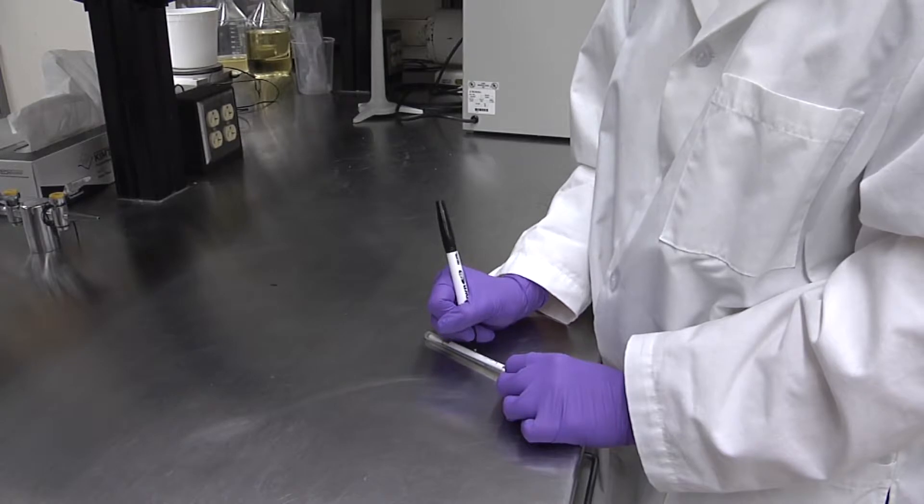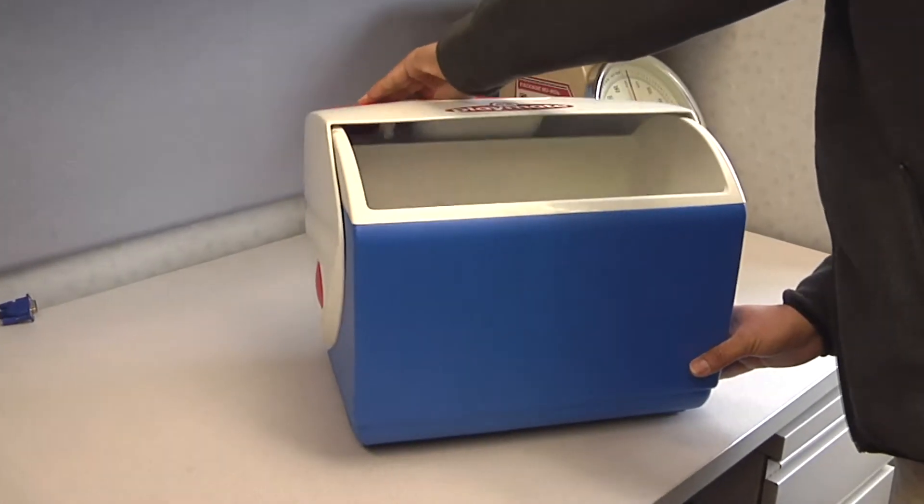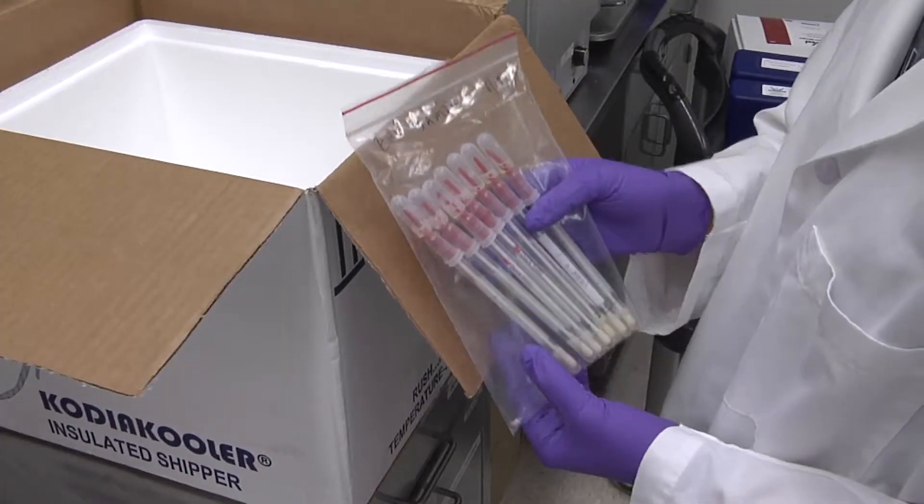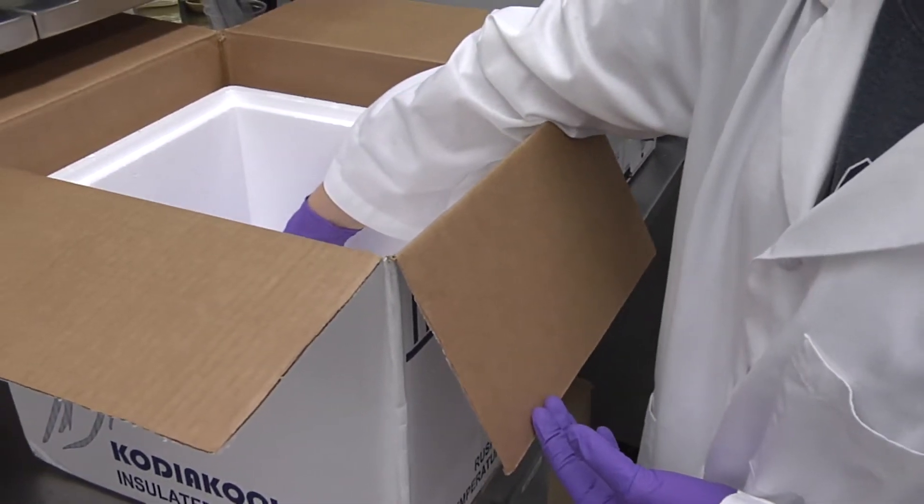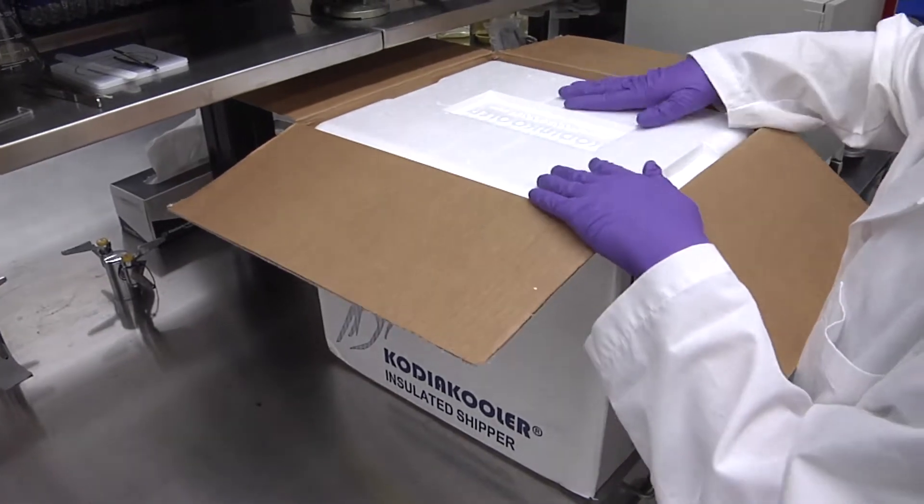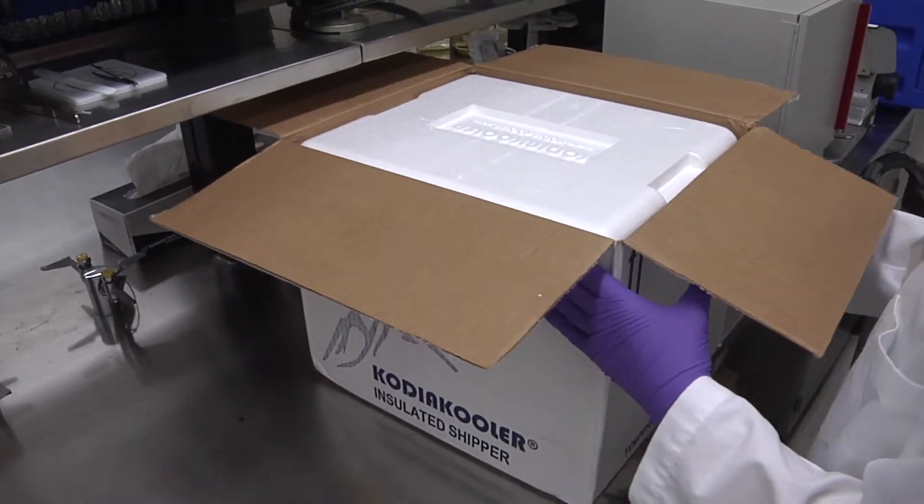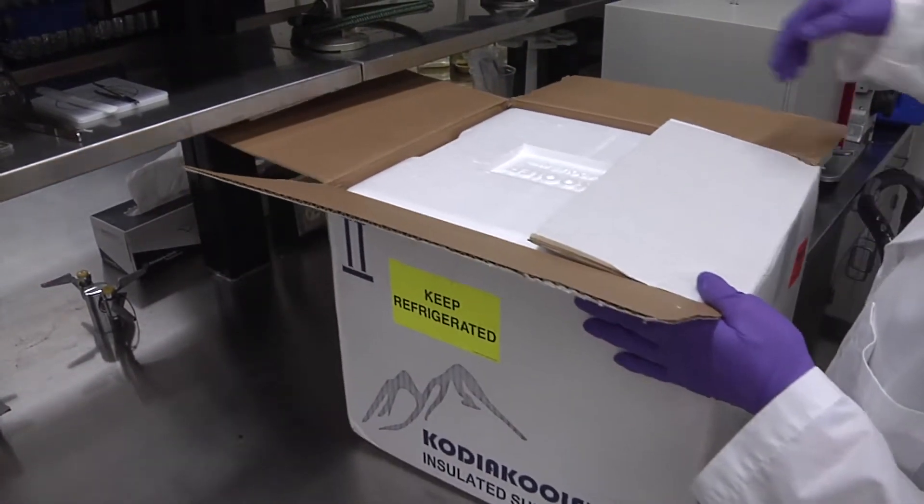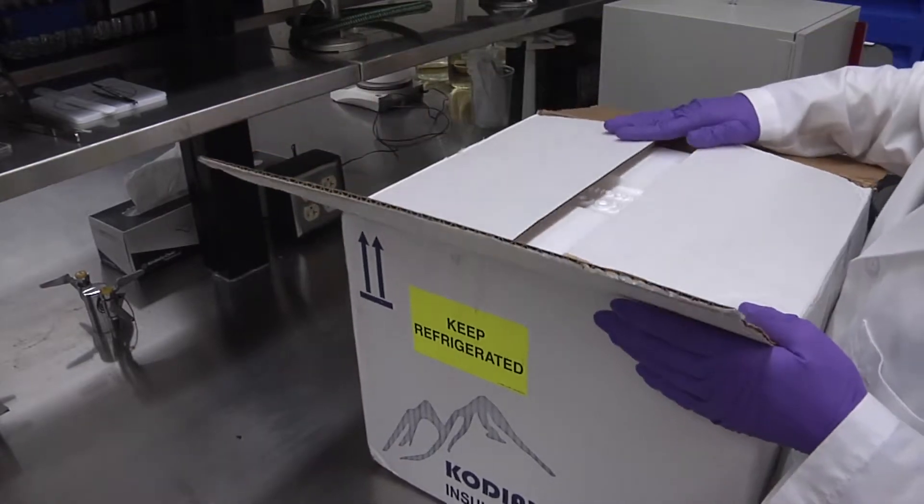If testing is going to be completed in-house, transfer the swabs to the laboratory. If it is being mailed, place the swabs in an insulated shipping container with a cold pack, seal the package, and ship for next day delivery. It is best to test swabs within 24 hours of sampling.